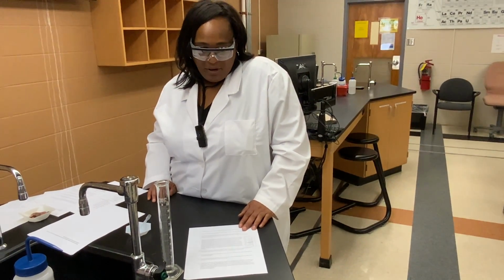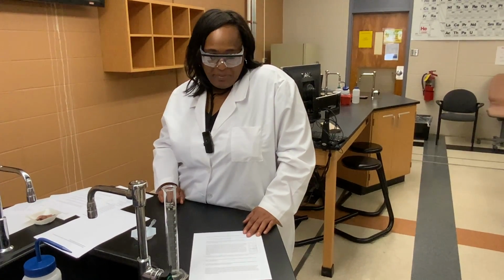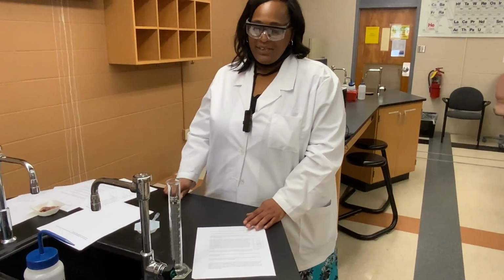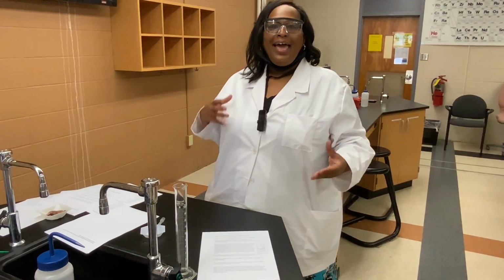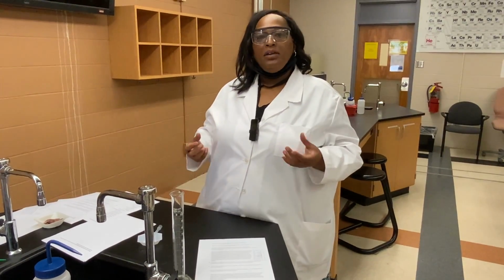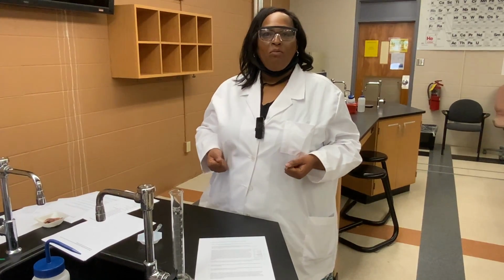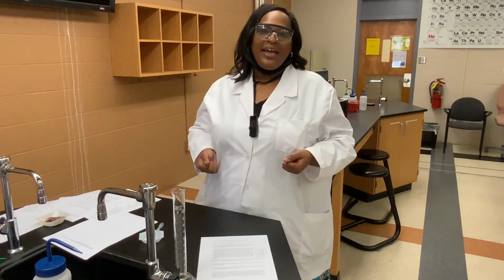And so therefore, the amount of water that gets displaced is going to be equal to the volume of the object. And so that's going to be the way in which we're going to determine the volume of a penny, by the water displacement method. And we'll continue on with that procedure for data set 3.